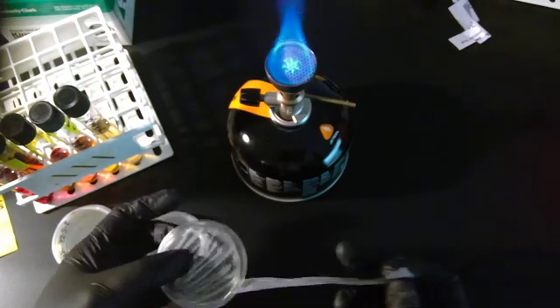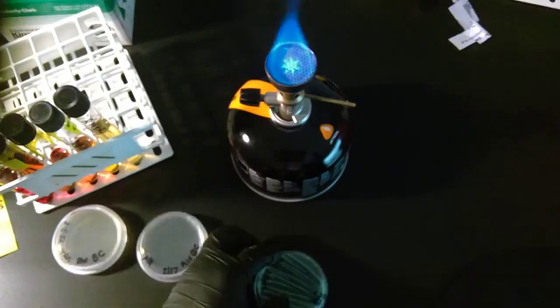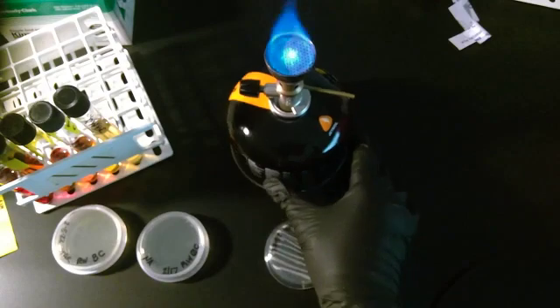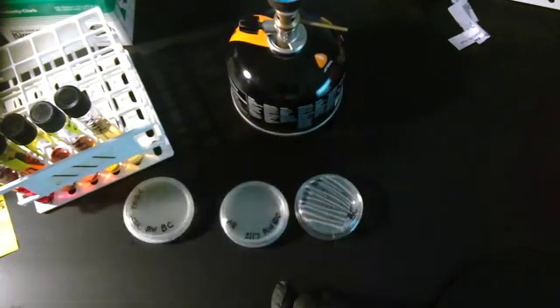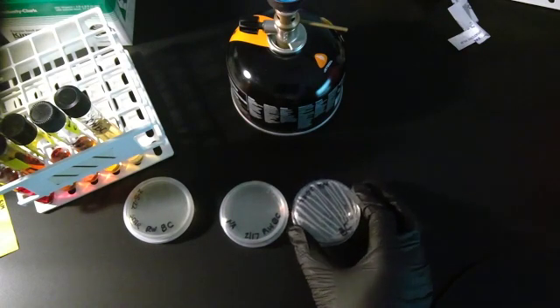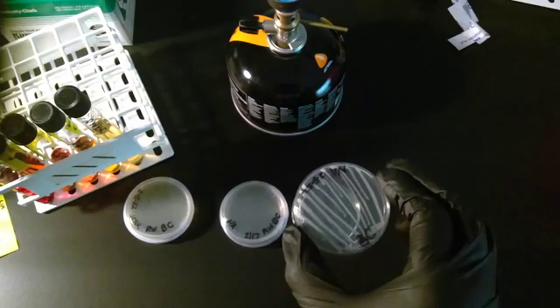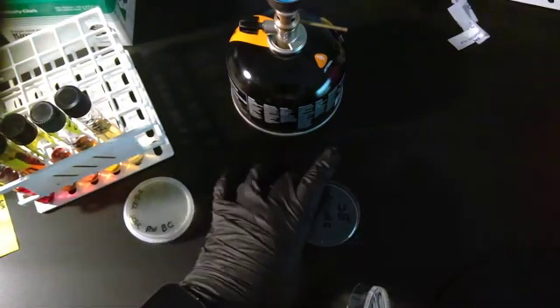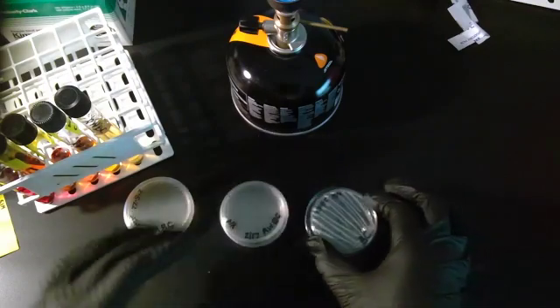We're going to open our sample, take the parafilm off. When I work with bacteria, I'm going to scoot that out of frame a bit so I can put these more into frame. When I work with bacteria, I tend to work with it upside down. If you look, the bacteria are actually on this side of the plate. This is the lid.